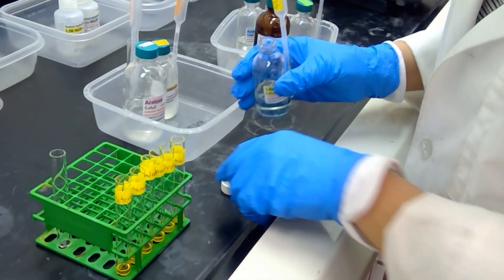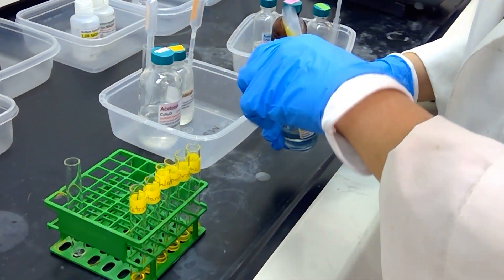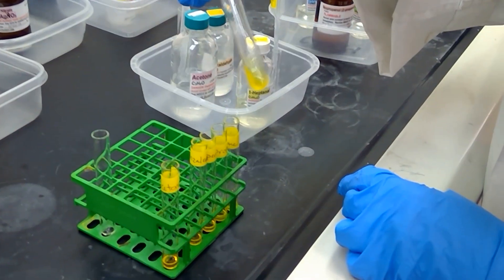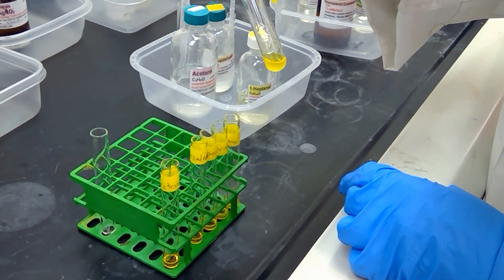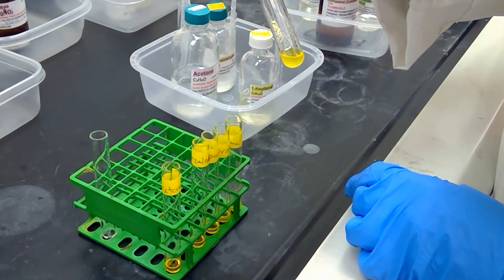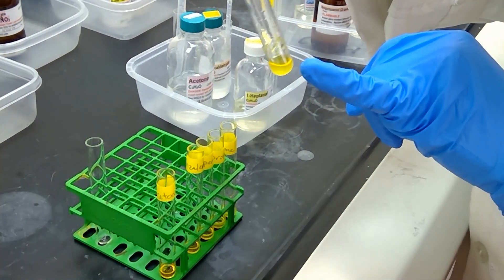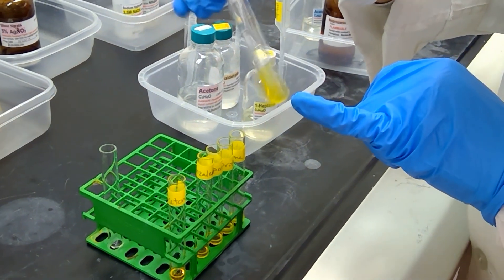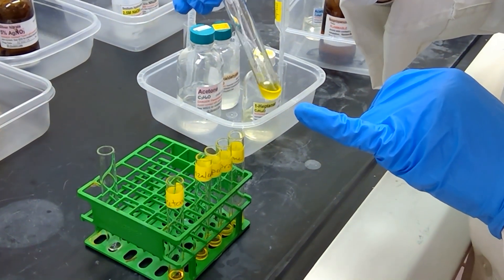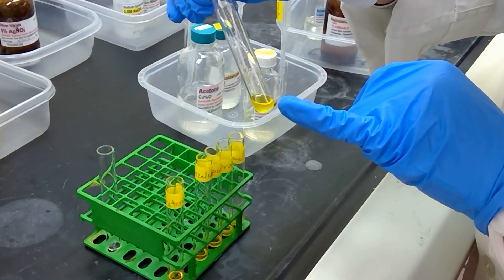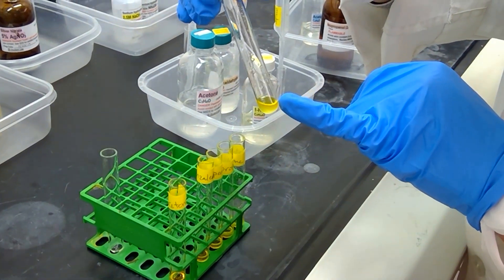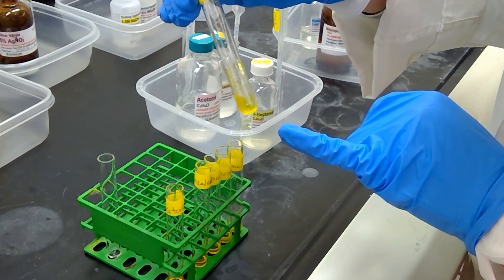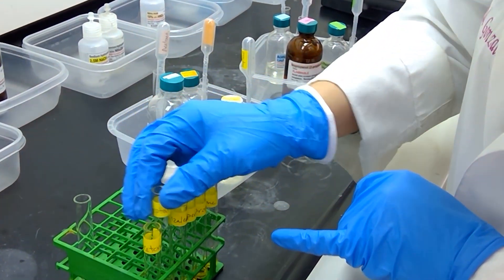I just added a little heptanol to the test tube for the heptanol sample, and it looks like we are getting some slight thickening of the solution here. On the walls of the test tube here, it looks like we're developing something for heptanol, but I'm going to put this one aside and let it react for a few moments.